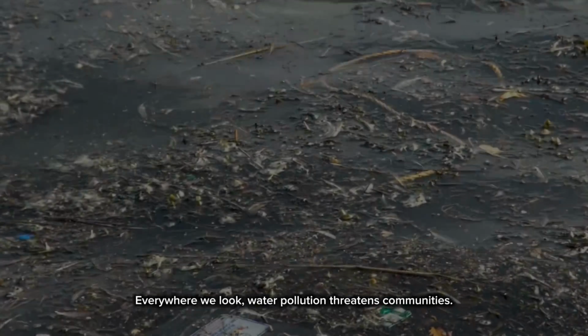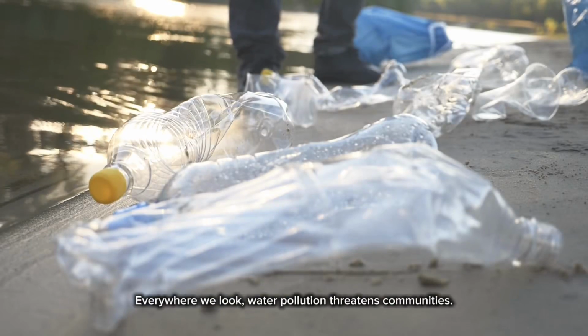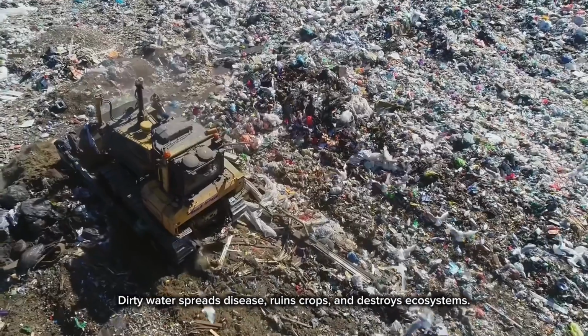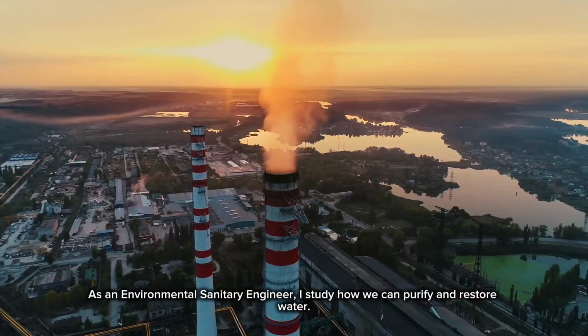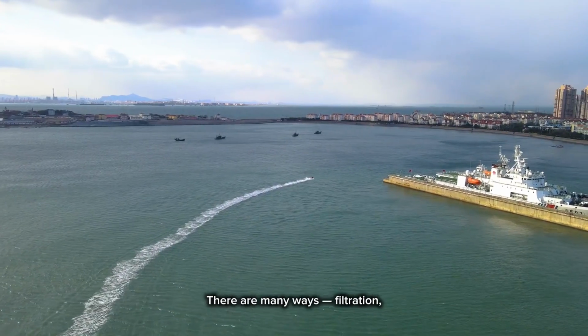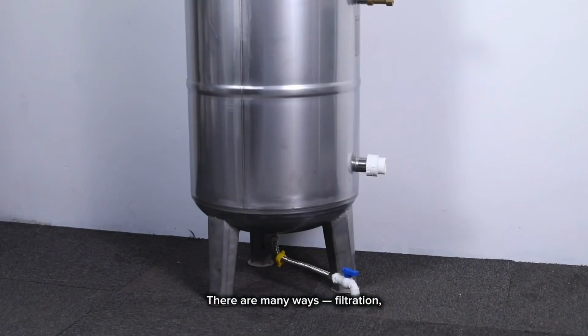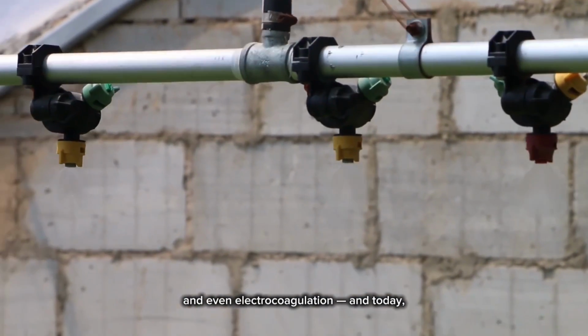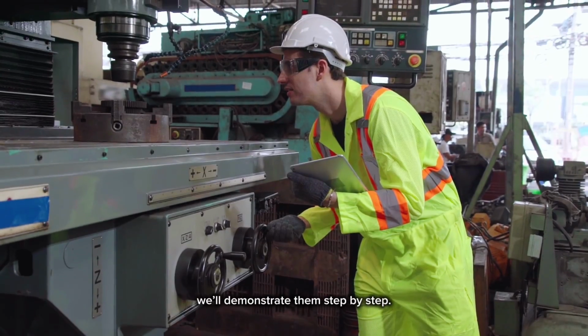Everywhere we look, water pollution threatens communities. Dirty water spreads disease, ruins crops, and destroys ecosystems. As an environmental sanitary engineer, I study how we can purify and restore water. There are many ways: filtration, coagulation, distillation, and even electrocoagulation, and today, we'll demonstrate them step by step.